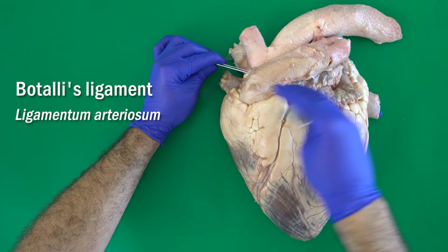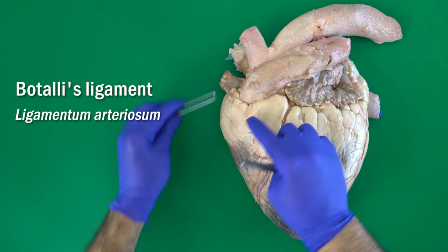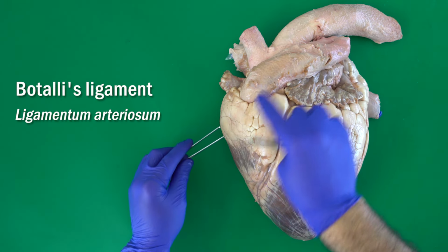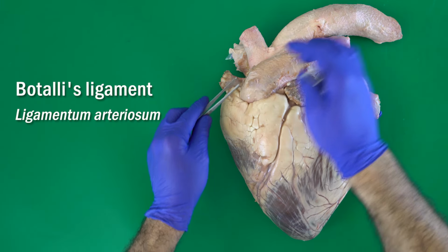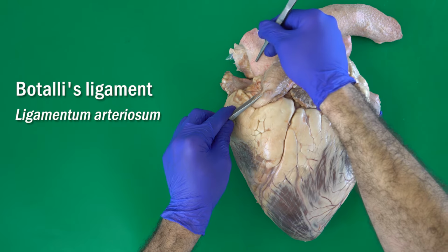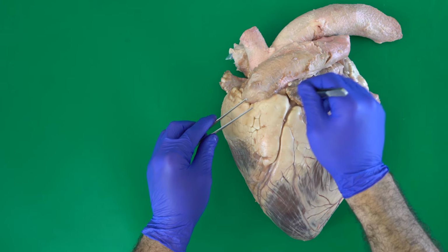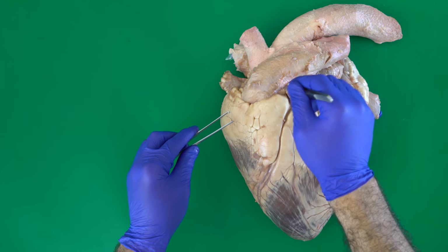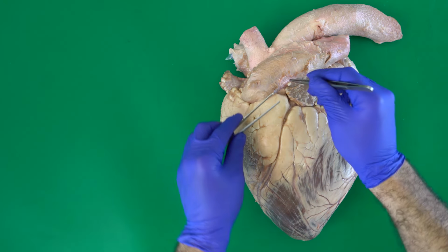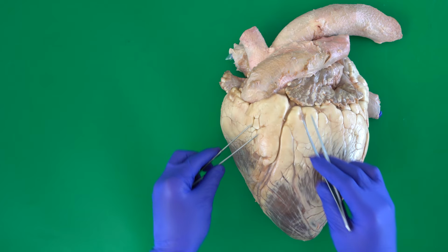As before birth, as you know, the lungs are not functional, and there is no need to push the blood from the right ventricle to the lung, and that's why the blood can move directly through the botalis duct from the pulmonary trunk to the aorta, and from there to the body. Another system is also located between the two atria, called the oval foramen, which serves the same purpose.